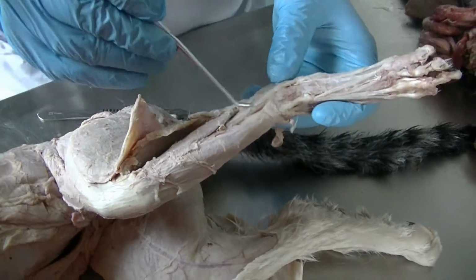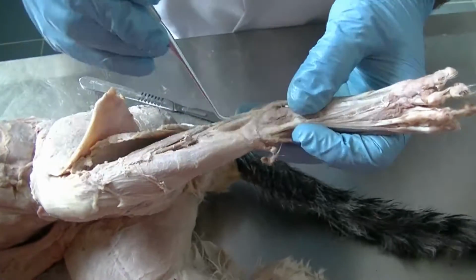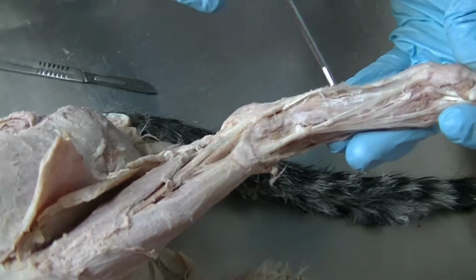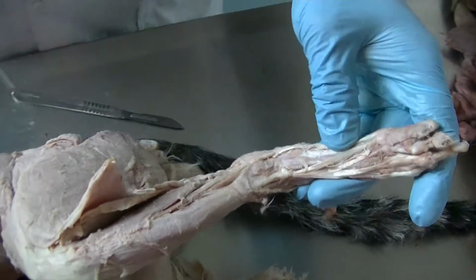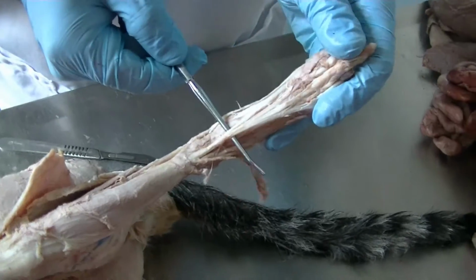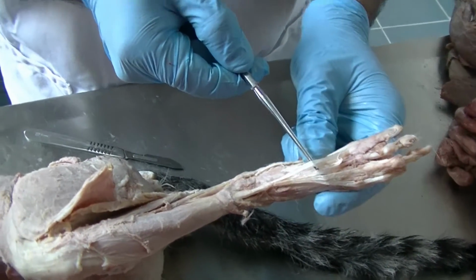The other muscles like your peroneus longus, which can be seen here, then the lateral digital extensor can also be seen as usual and does the same thing in the cat as it does in the dog. But then, as usual in the hind limb, we see 2 different sets of the extensor muscles.